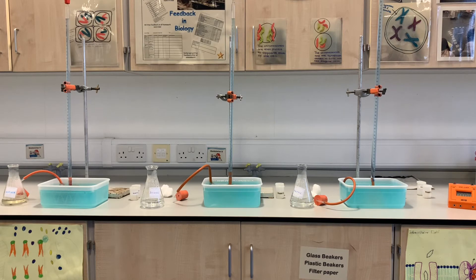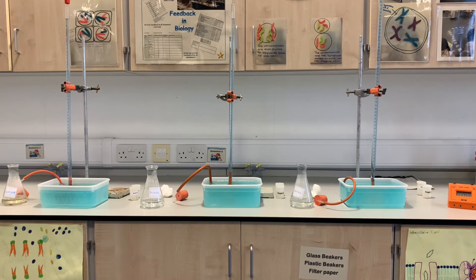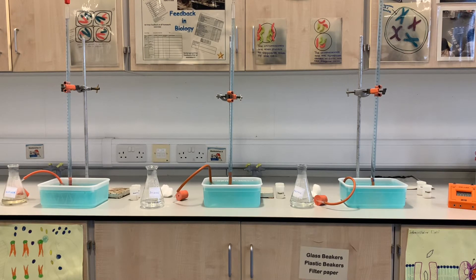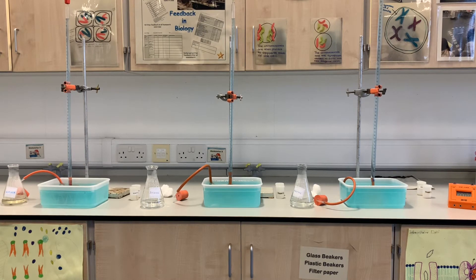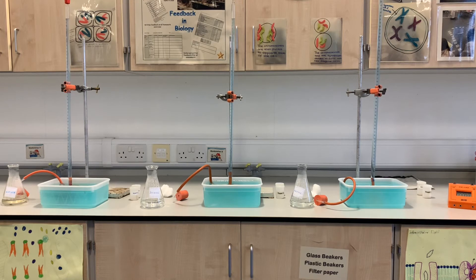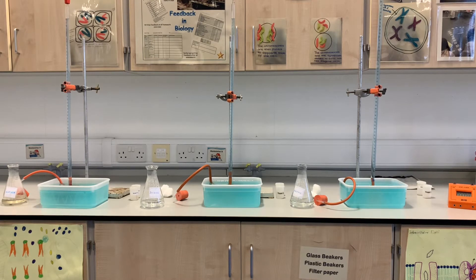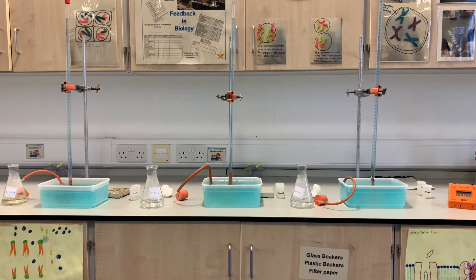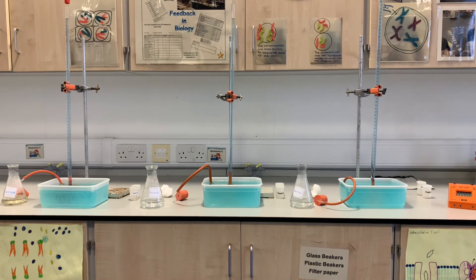We're going to add yeast to our glucose, sucrose, and maltose solutions — one gram of yeast into each one. We're going to put the bung on the top so that all of the carbon dioxide gas produced by the respiring yeast is forced into the coloured tubes, which will displace the water, causing the level to drop. I'm going to monitor that over a period of two hours, checking every five minutes, and hopefully by the end we'll prove which one is the best respiratory substrate for yeast.